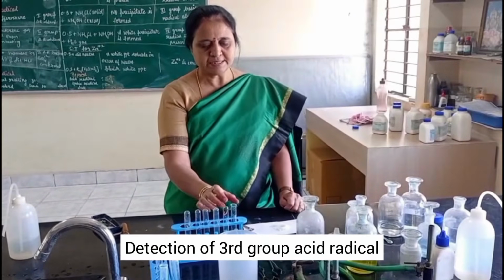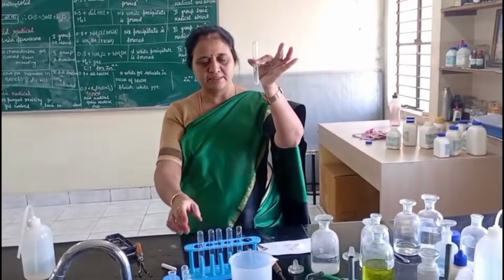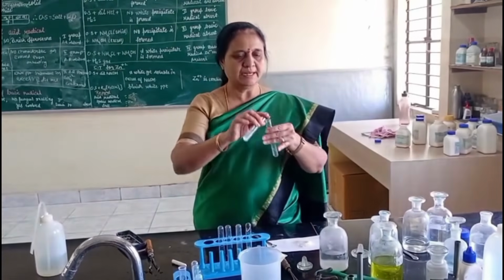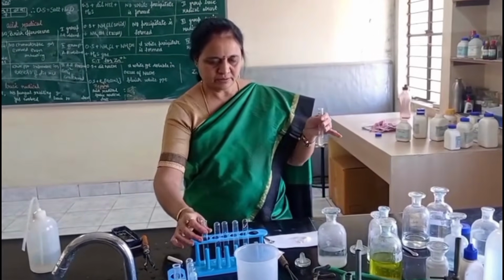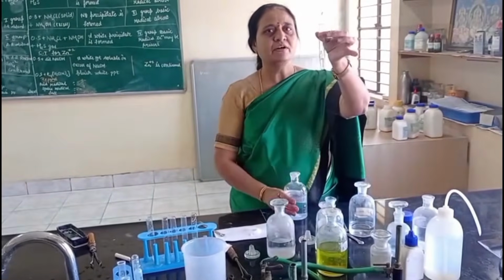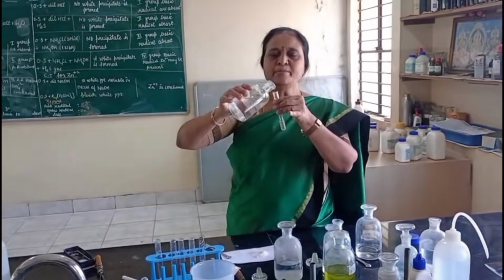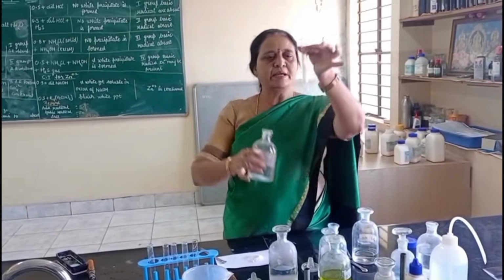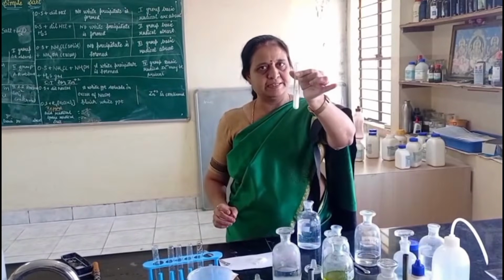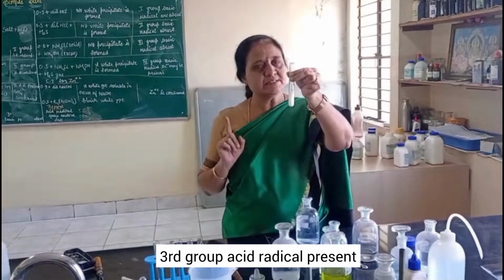Detection of third group acid radical. For this I take salt solution, salt plus water. I take 2 to 3 drops of salt solution and add barium chloride solution to this. I am getting thick white precipitate. Formation of thick white precipitate indicates that third group acid radical sulfate is present.